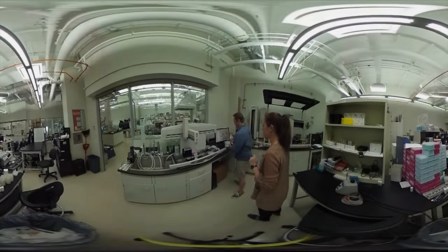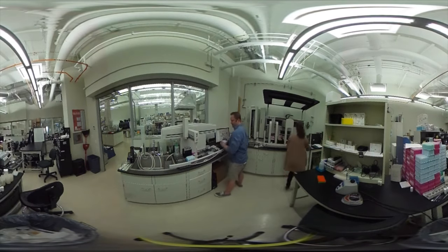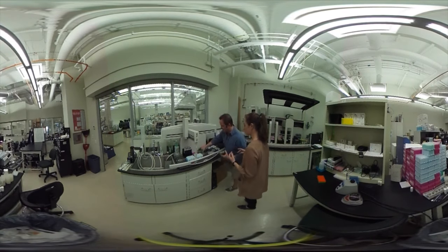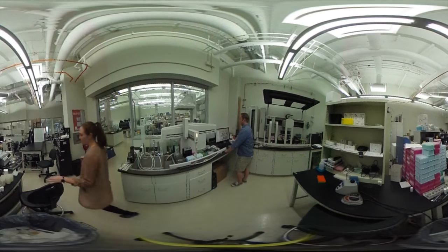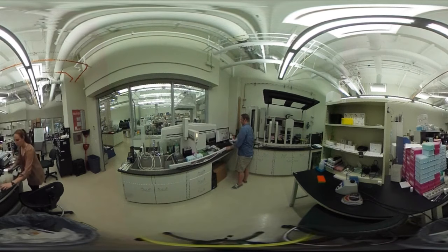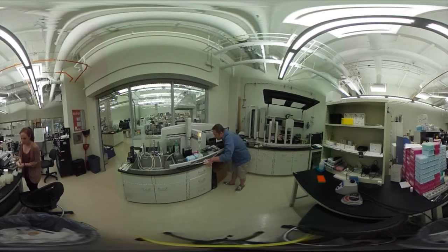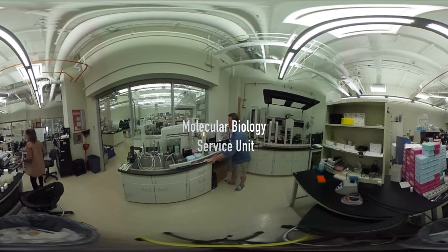With all technology there's a limitation, and that's humans. We move into robotics platforms to increase throughput — robots can work for longer periods without fatiguing. Robotics are a really fun tool, but there's always a trade-off: they increase research costs. For a small experiment, robotics isn't the right approach, but once you get into larger datasets, robotics are definitely the way to go — they allow you, the researcher, to turn around and do other things while the robot does the hard work.